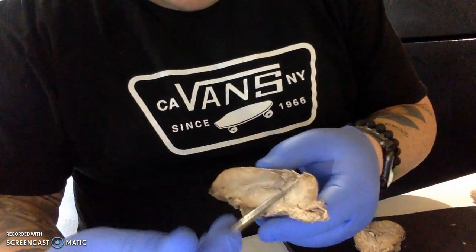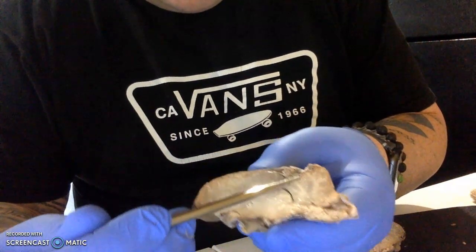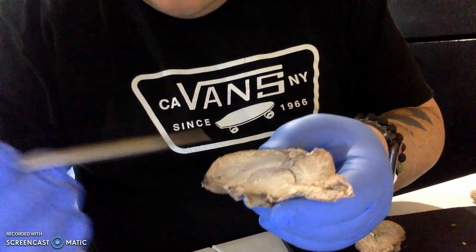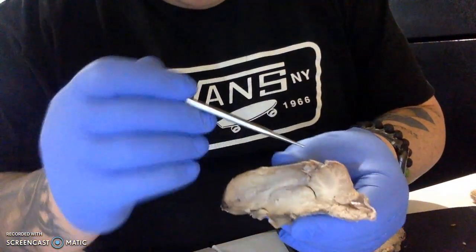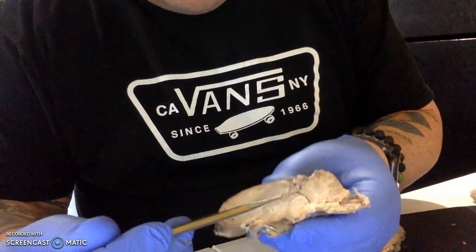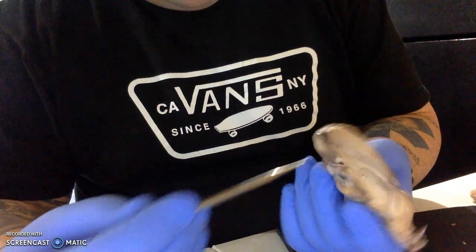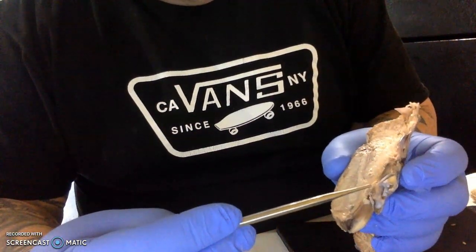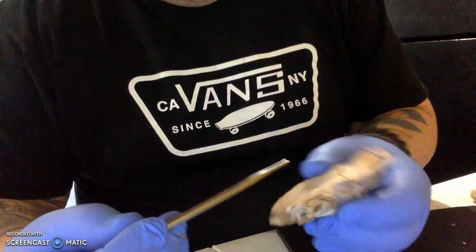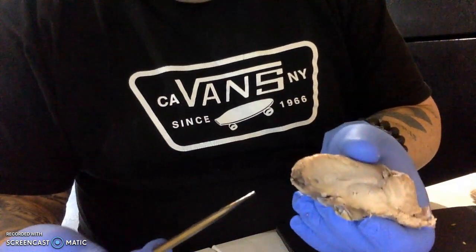We also have this structure here, which is the cerebellum. Cerebellum is made up of white matter, which you can kind of see the whiter, lighter matter here, and then the gray matter. And then again, you can still see some of the meninges that are exposed. Some other structures that I was able to locate were the pineal gland. We had some olfactory bulbs on both sides. We had some of the optic nerves here in the optic pathway, and I was also able to locate a few of the cranial nerves as I was looking my way through this.